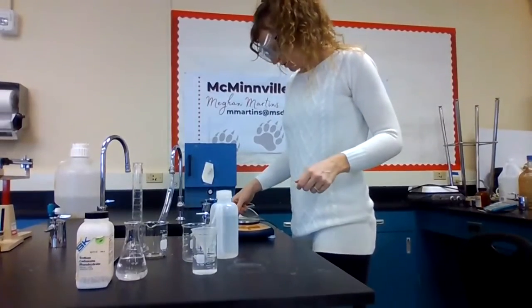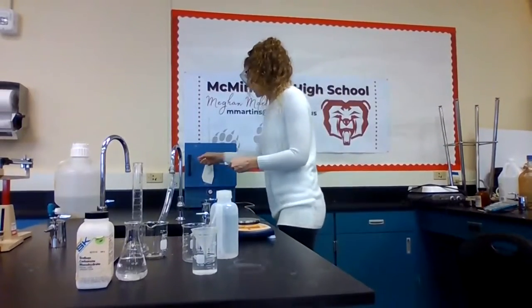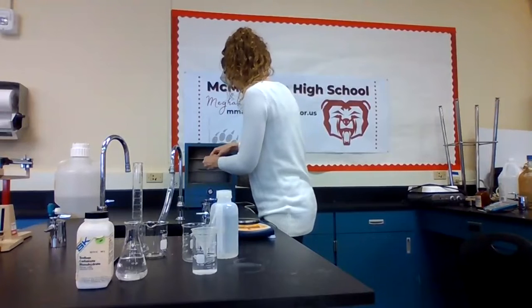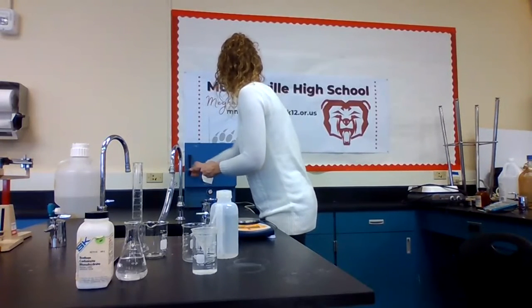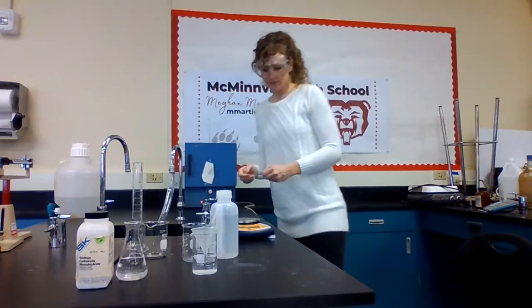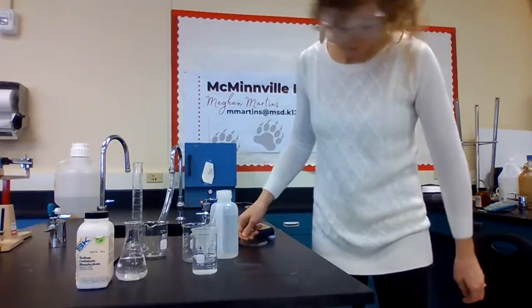And we will put this in our drying oven and check it in 10 minutes.